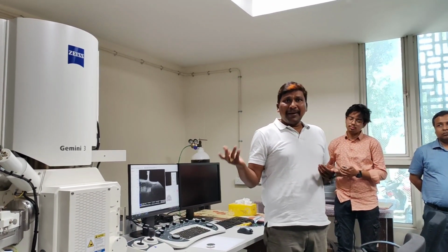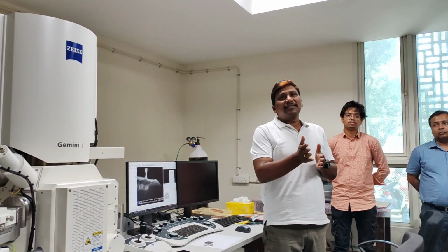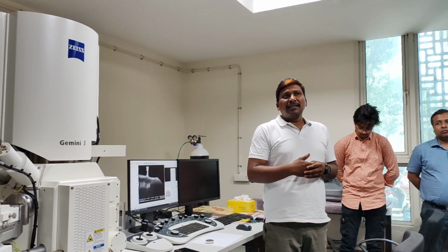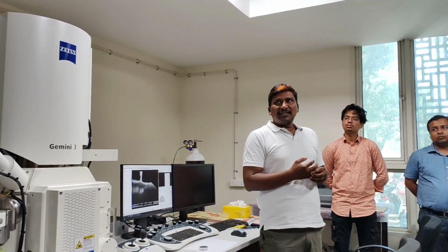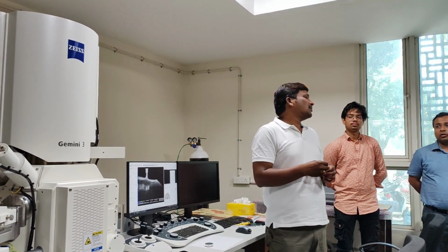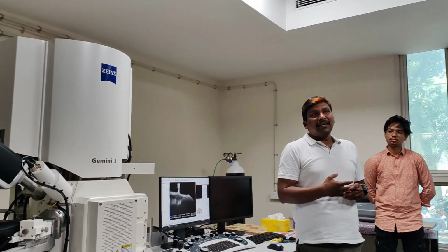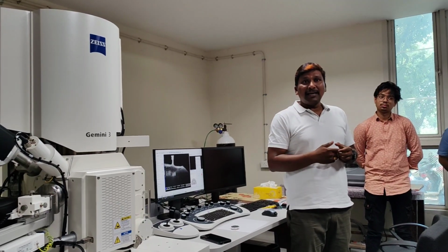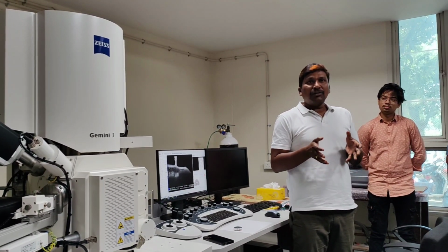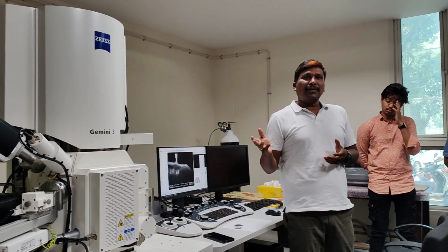In accidents, you can examine paint thickness and multiple paint layers, because when a vehicle touches some other body, paint transfers. There is also a dedicated special software for GSR, gunshot residue, where you can identify a person who was present at a particular murder. There are so many applications. If you take the forensic side, the application is completely different.